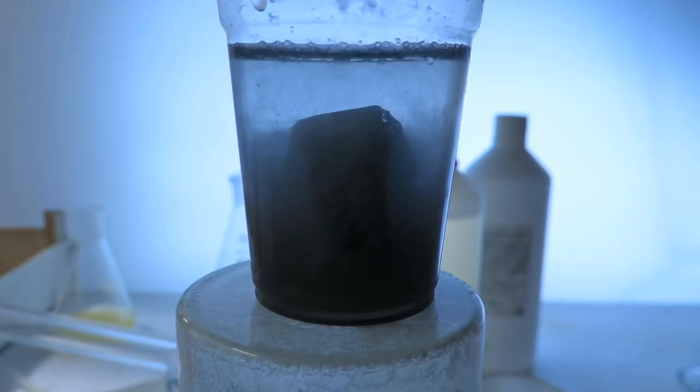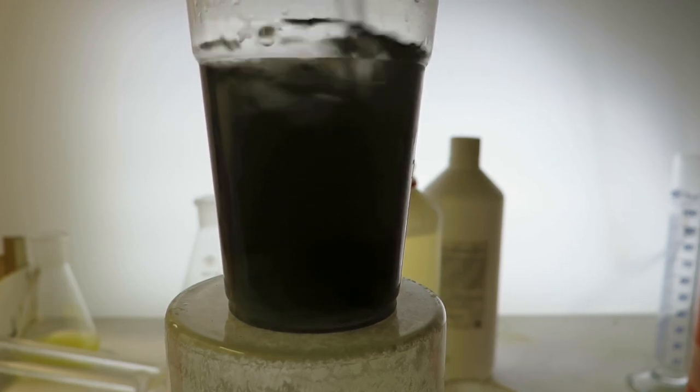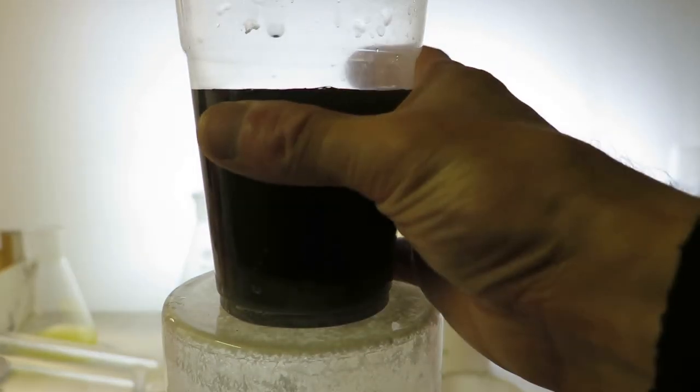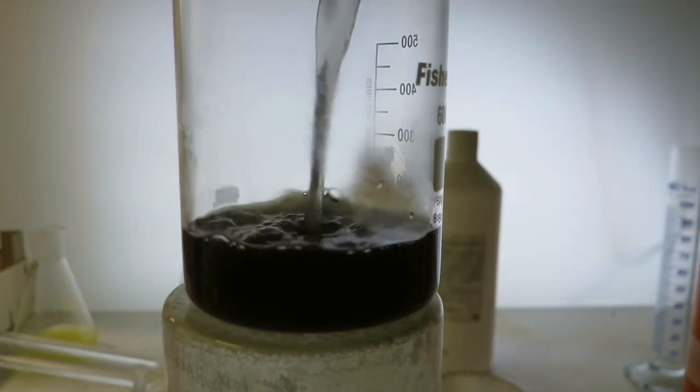I was really unsure about what this black thing is, because as you can see, it bubbles. So I would say, of course, that's aluminium, right? It bubbles. It must have somehow dissolved, and then when it gets water, it will react. But is it really? Well, I can already see some solids. Okay, this is quite black actually, so I think I am done with this, and let's see what we get.